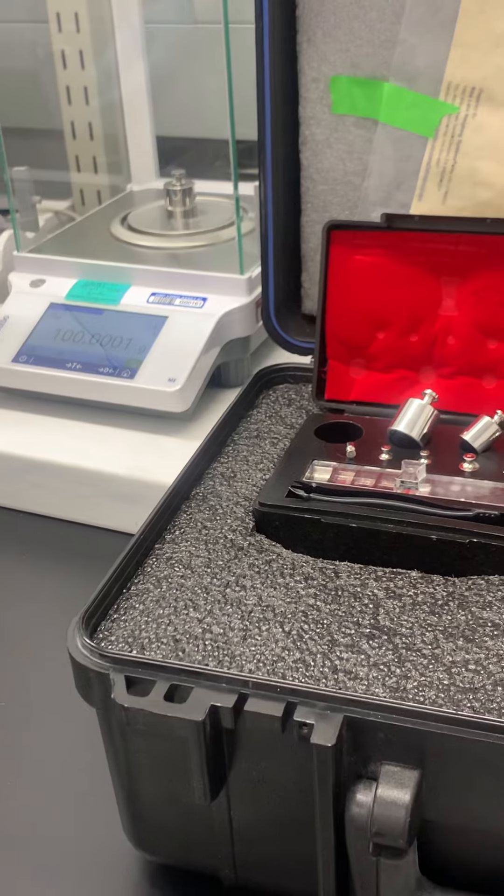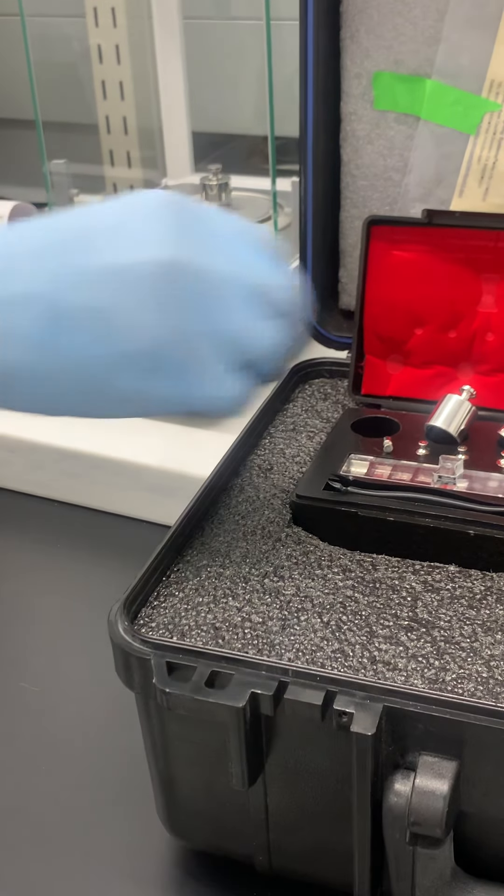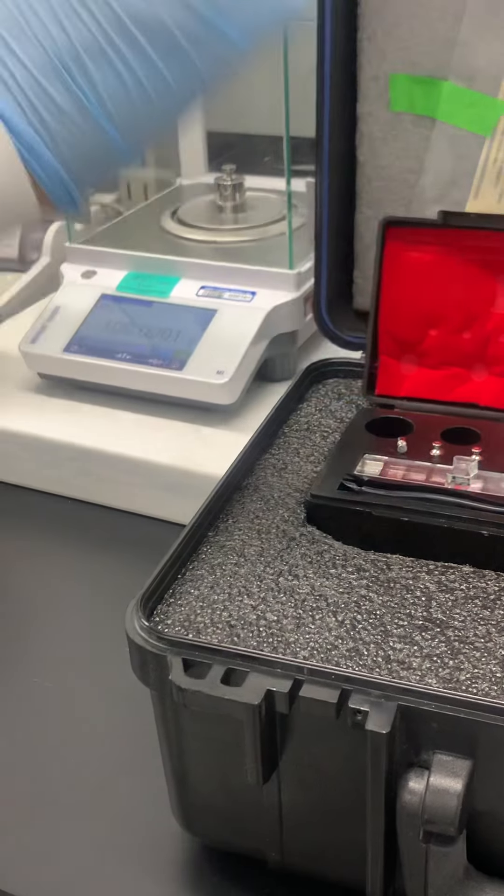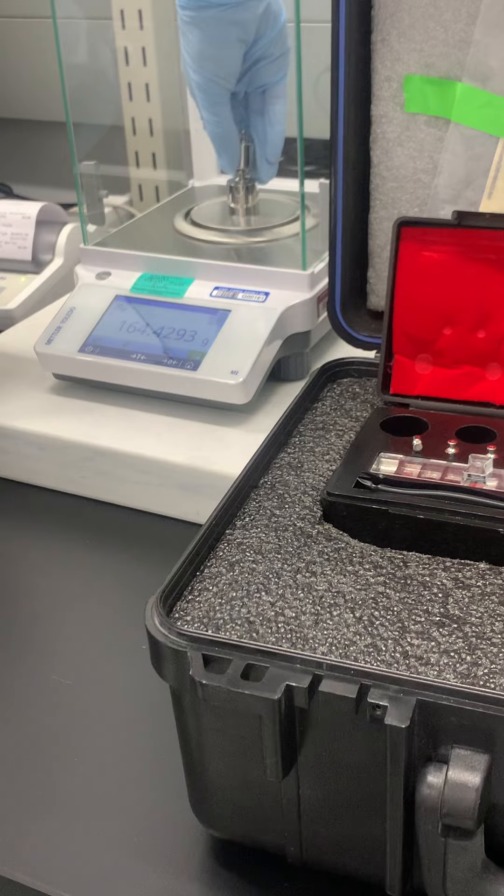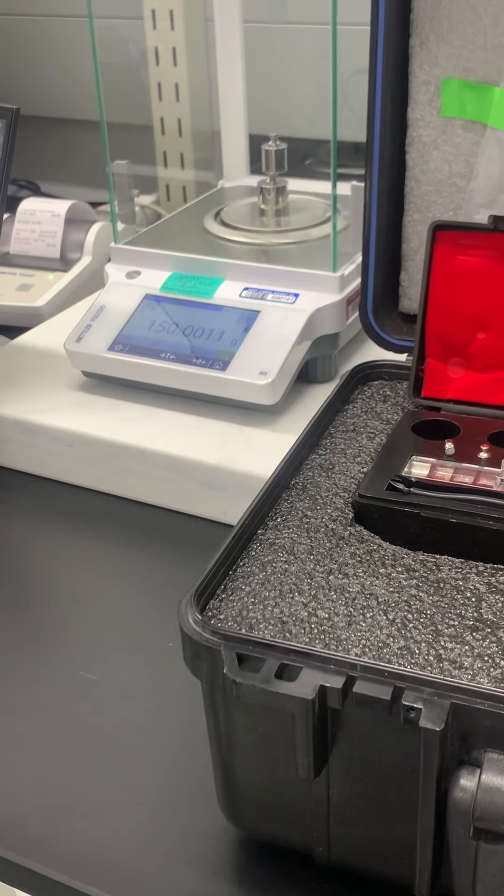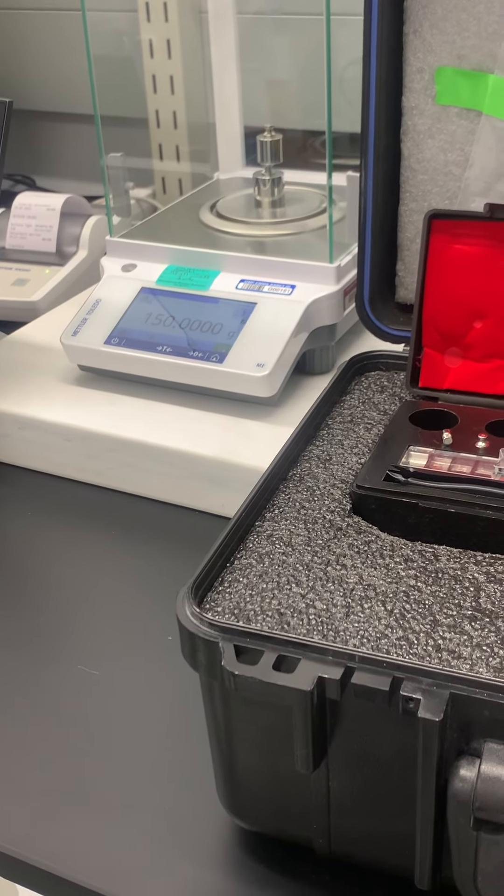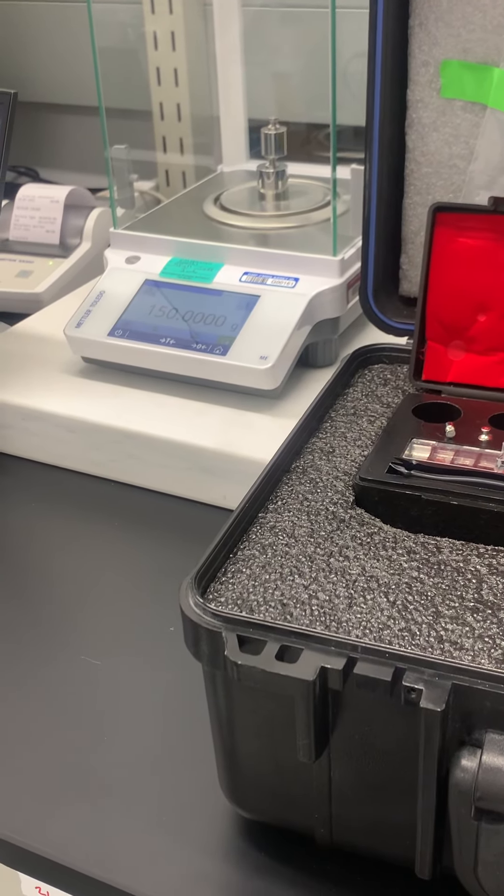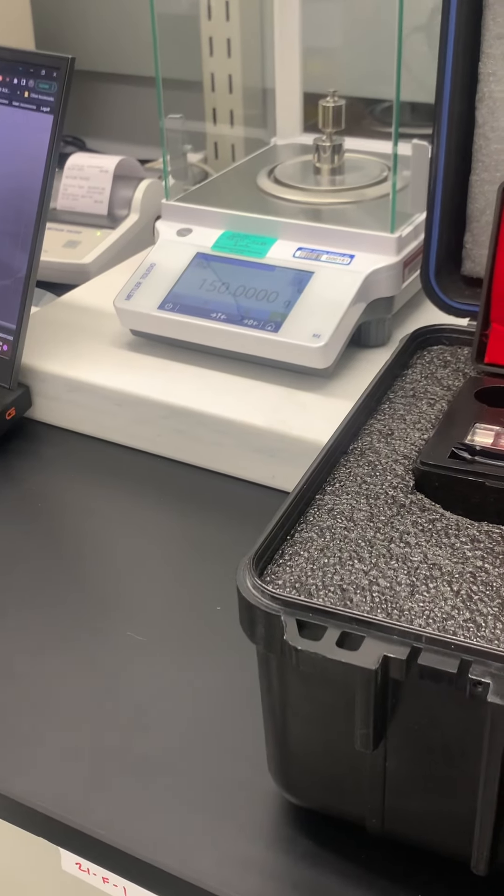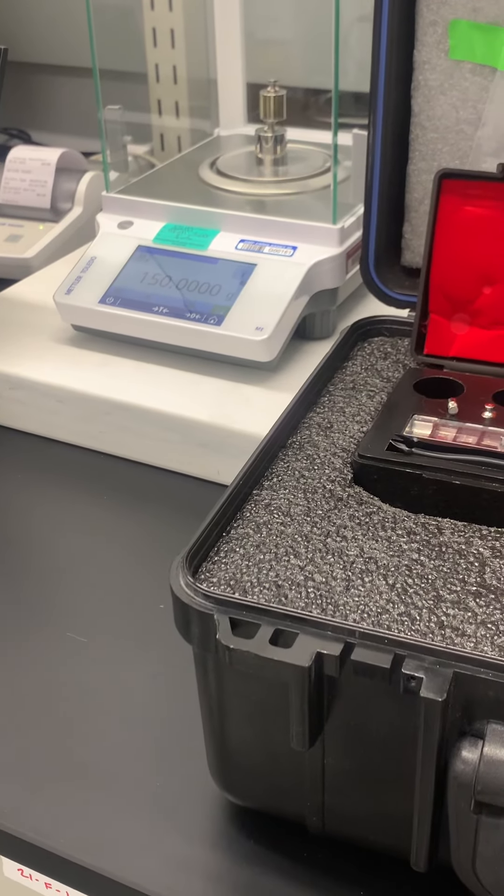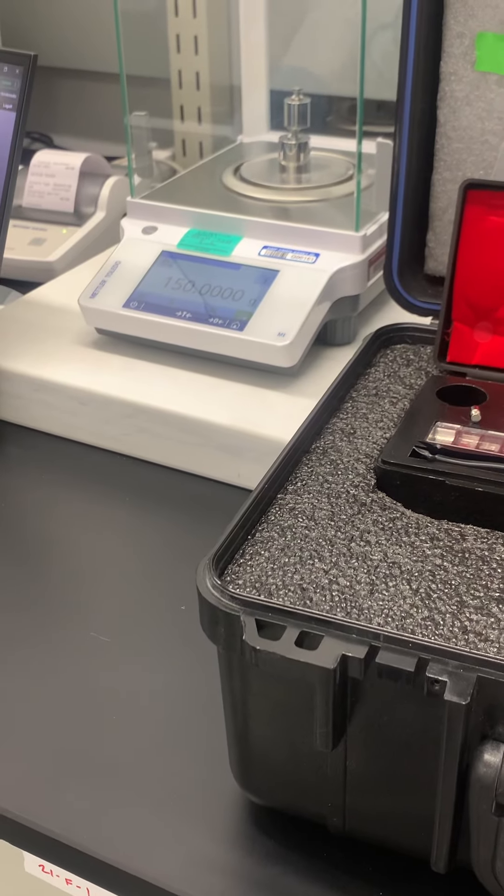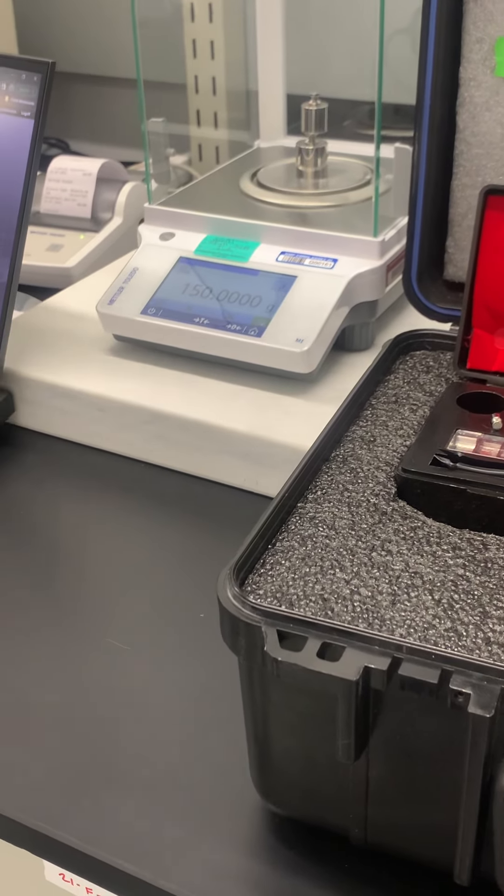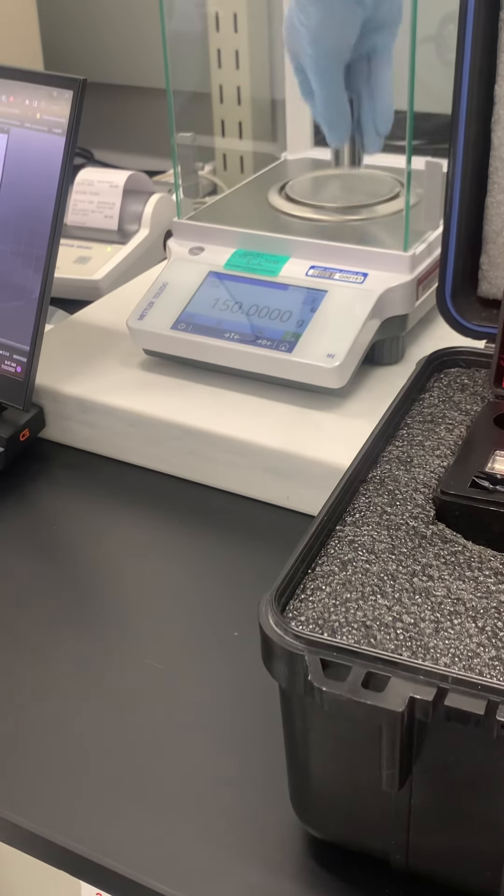All right, so for this one it's like 'oh I have to hit 150', just use the 100 and 50. Nice little tower. Oh so you don't stack them next to each other? You can if there's a bunch of them. I just try to tower it up as evenly as possible. Then you get a nice round number that you can't beat.